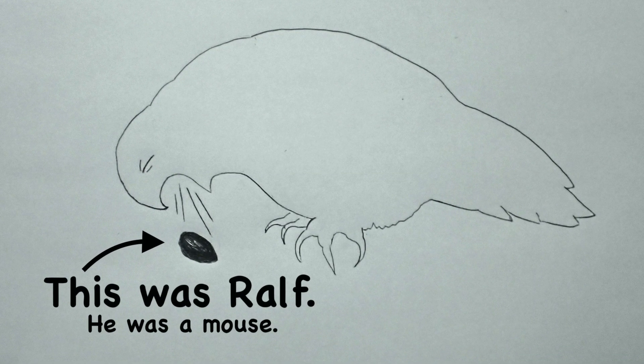Eventually, when everything is squeezed out of that food, the owl will cough up those undigestibles in the form of a pellet, and it kind of looks like — well, looks like this. This is from a barn owl and it kind of looks like it came out the other end, doesn't it? They come out a little moist, kind of like a hairball.